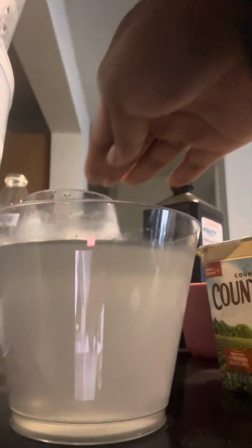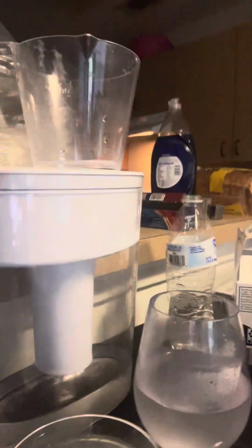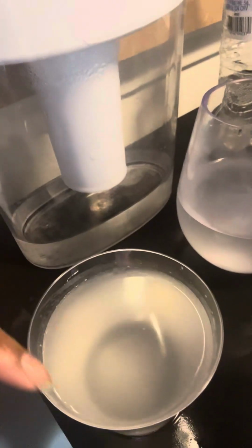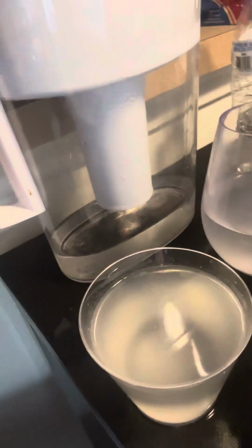I had my distilled water, my filtered water. This was my B solution right over here. This was my final product, my final solution. And as you can tell, it's very cloudy. It's not clear. I did heat up my B solution right up here. You can even see the condensation on it. But it just did not react the way that it was supposed to react. I can even see some flakes on the top of the cup, so maybe it just didn't get filtered correctly.